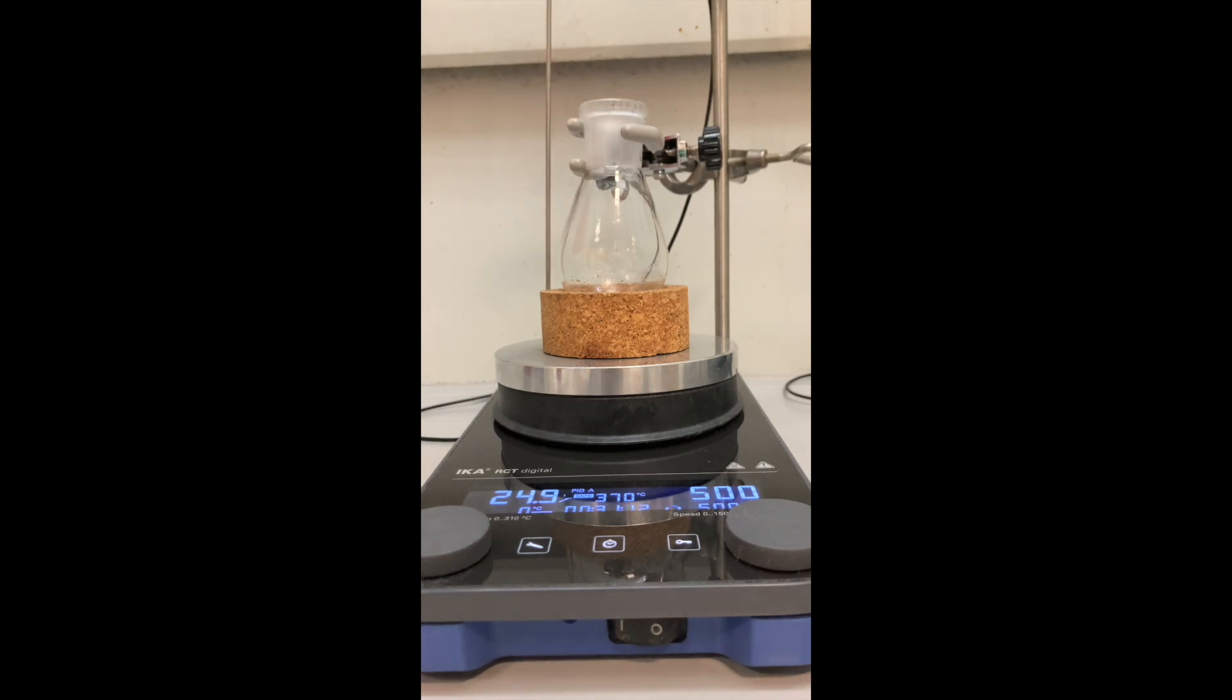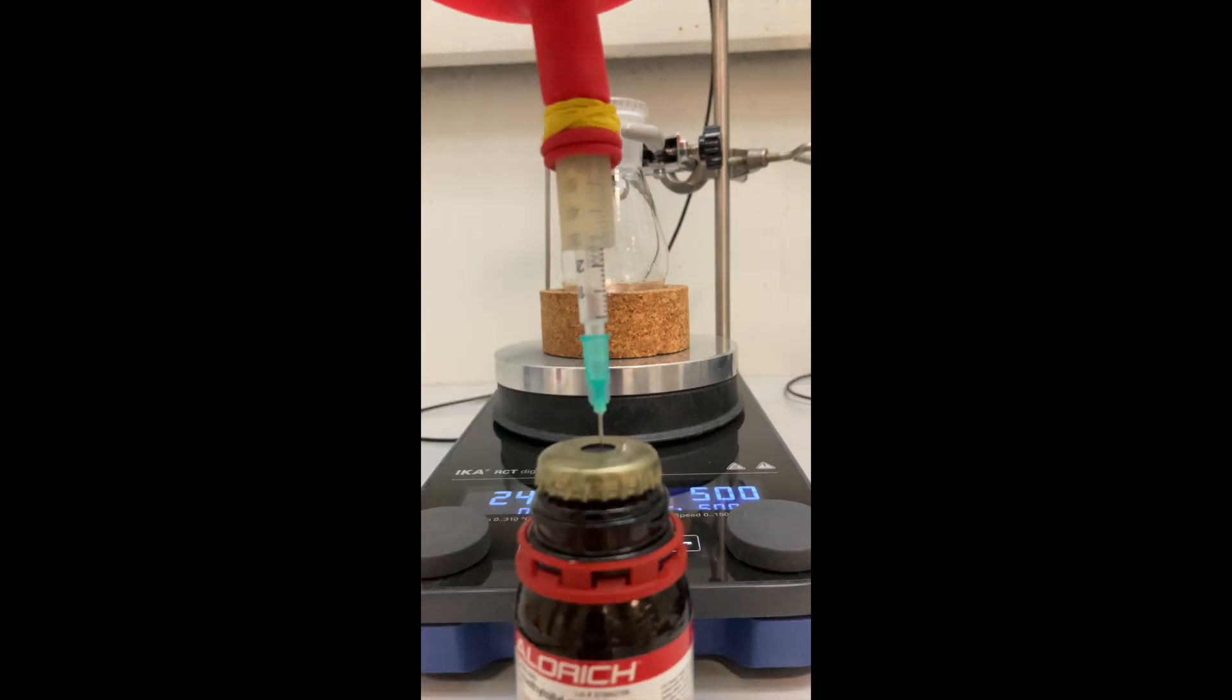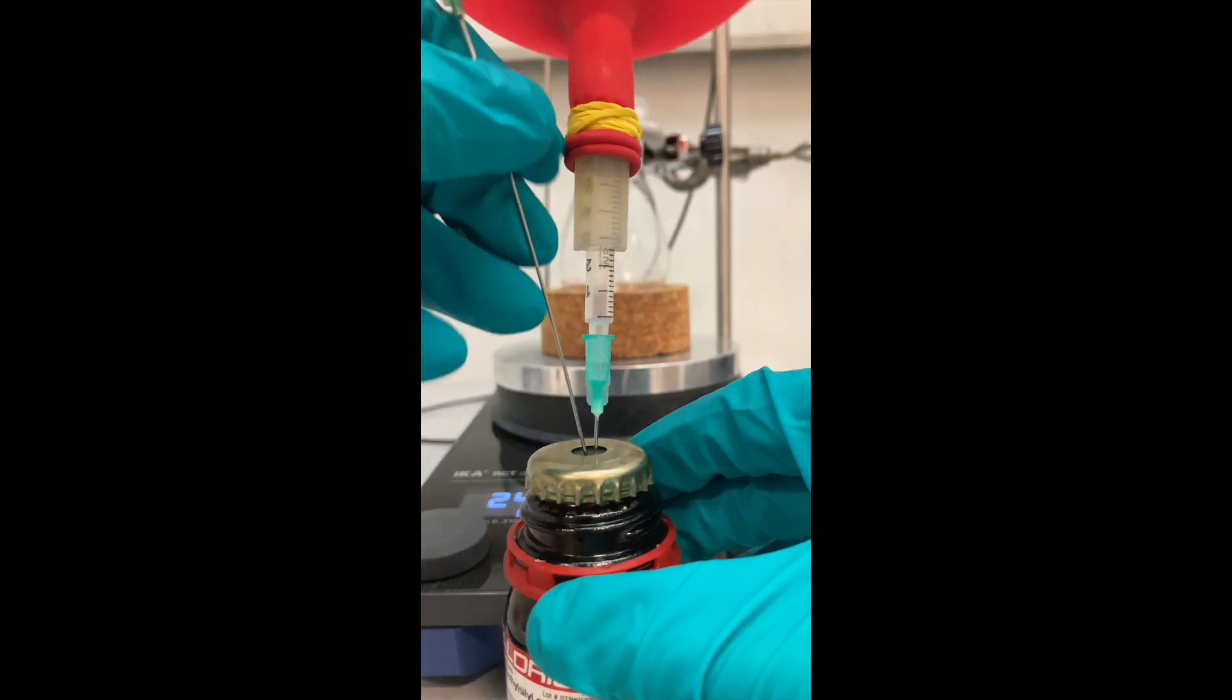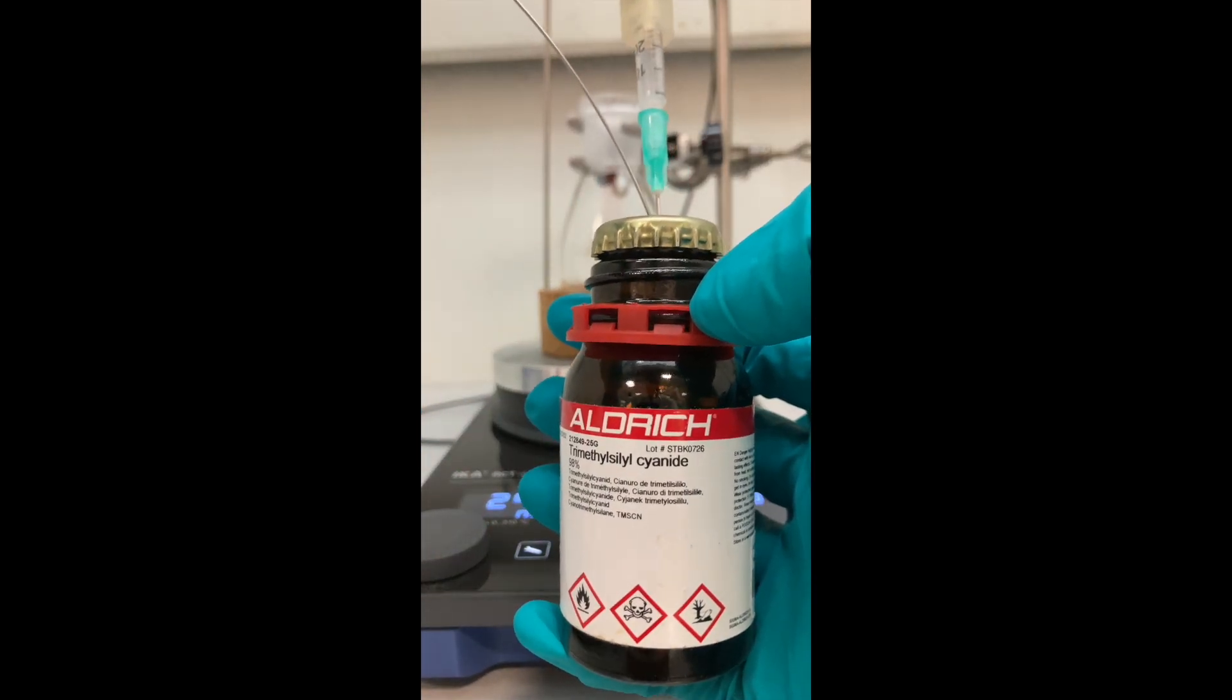Then, I added TMS cyanide to the reaction mixture. It is important to note here that cyanide is highly toxic and direct exposure to any of its forms should be avoided.